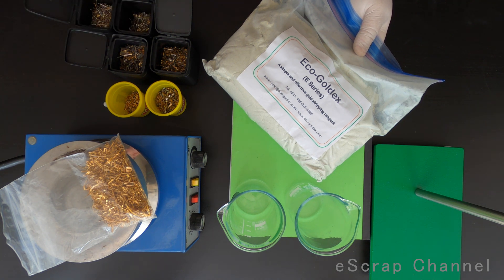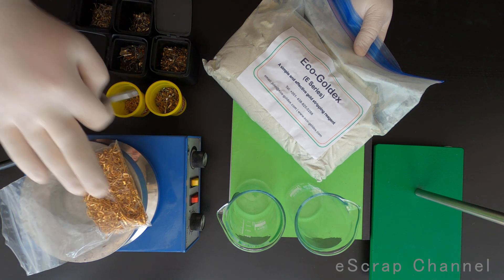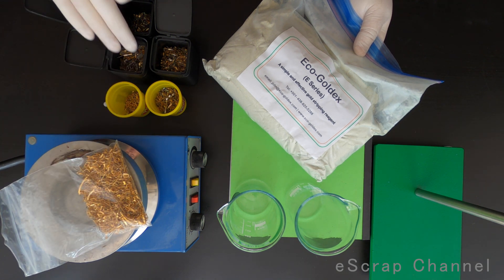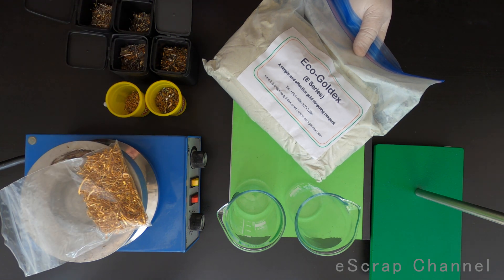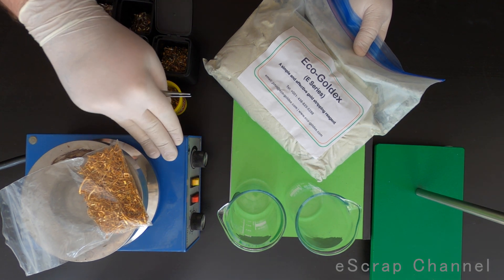As for the manual, I should start with the best material I have and go to the worst material, to the modern pins that have really thin gold plating on top. I have my magnetic stirrer, it's also a heater.